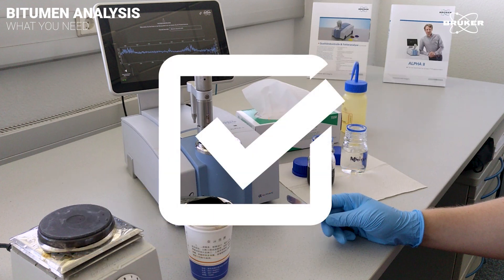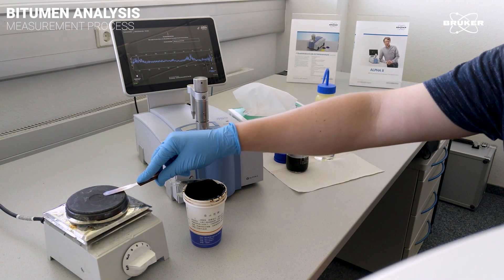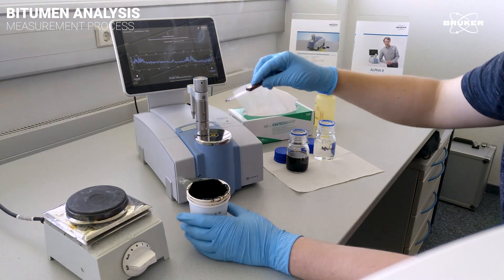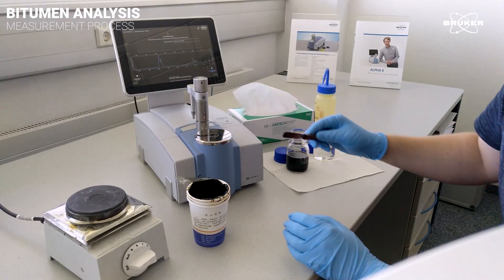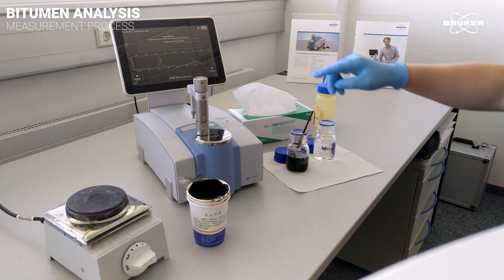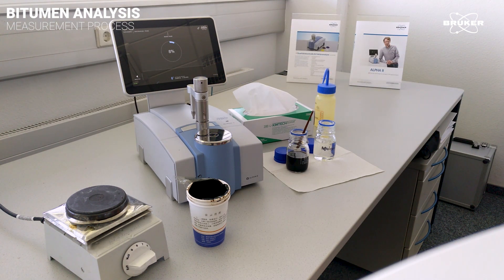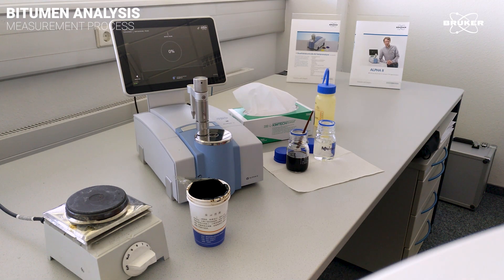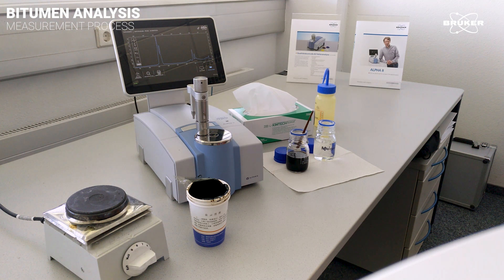When everything is prepared, we start by heating up the spatula. Then, the hot spatula is put into the bitumen, which is then spread evenly on the ATR crystal. After using the spatula and letting it cool down, it is soaked in a jar filled with kerosene to make cleaning easier. The measurement itself starts with a single touch. After a few seconds, the Alpha-2 automatically shows the sample spectra, which now allows statements about the bitumen's quality, for example, the amount of thermoplastic olefin added to it.